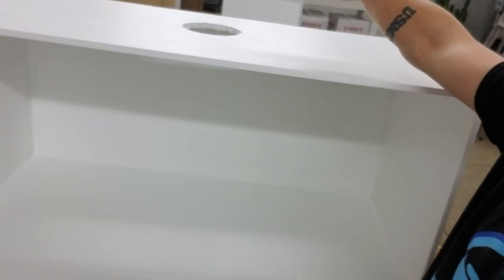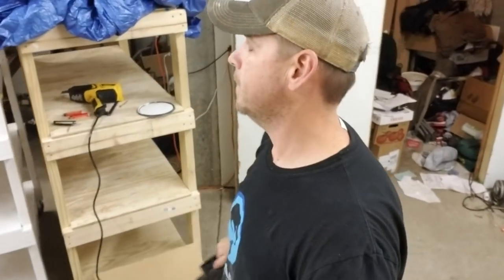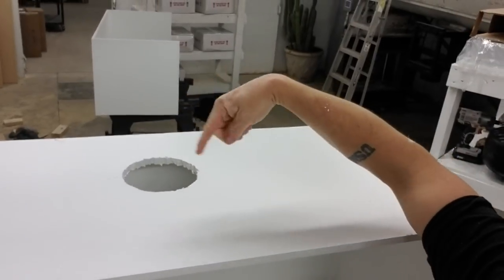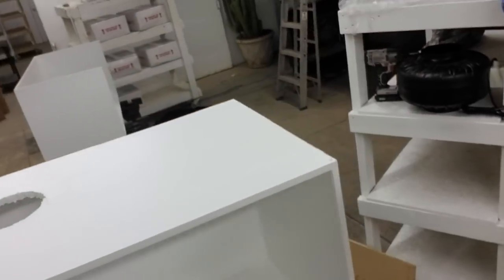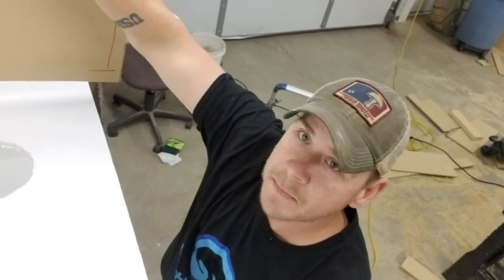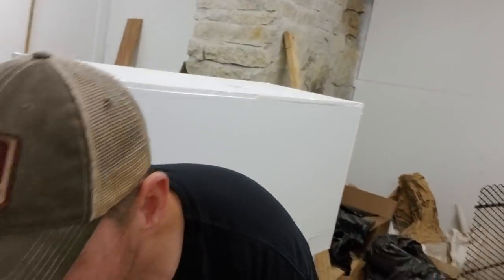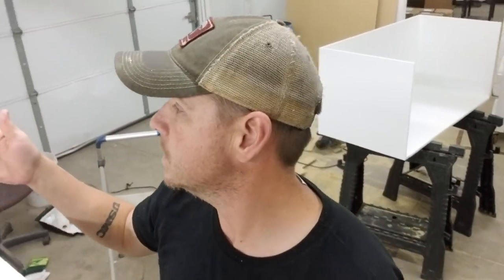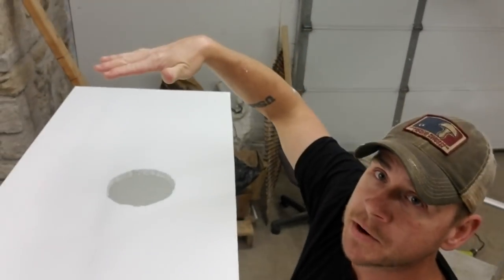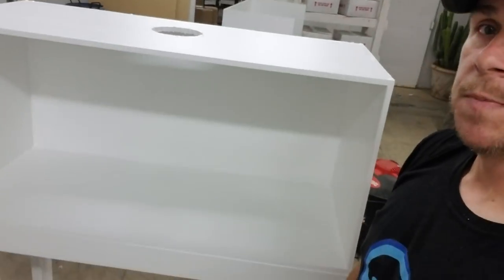The filter just goes right in here, fan on top. I'm going to use a can fan - you can pick these up for anywhere from $50 to $100 online. Put a hole there, seal around the hole after the fan is in. There's going to be a filter housing out of leftover particle board - we're literally building another box on top of where the fan goes, put a filter on top, and that'll be our coarse filter. I'm using a 15 by 20, so this is 20 inches wide. 15 by 20 coarse filter on top, so we don't gum up our HEPAs.